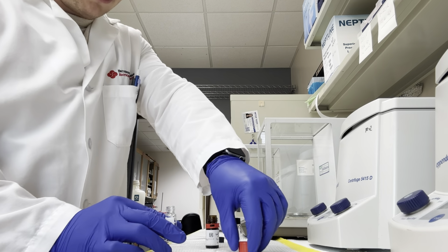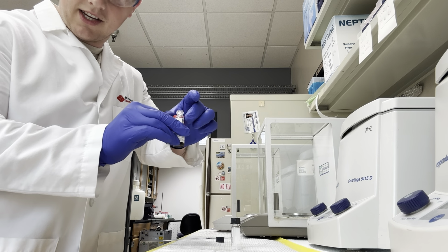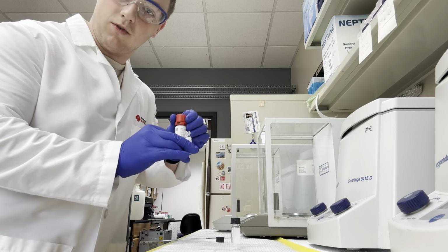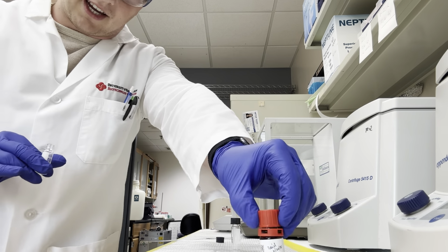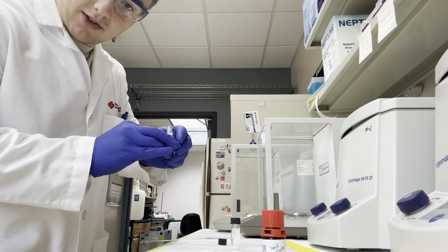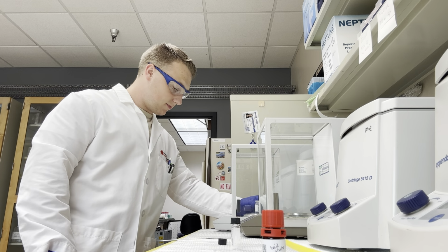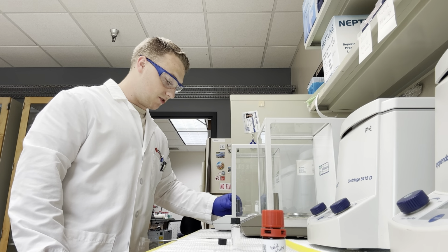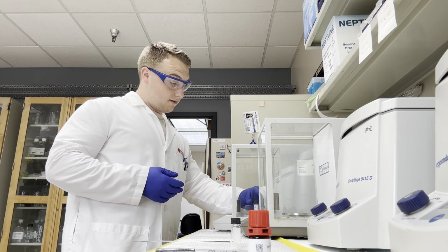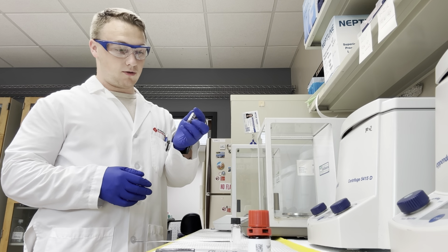The first thing we want to do is make sure that our stock is all sealed up. Obviously if our stock is contaminated, then it ruins everything, and we have to buy another one. So let's make sure that's clean and taken care of. Now again, no cap, because we didn't zero the scale with the cap on. We're going to put this back on, and our scale is going to give us a measurement. Once we've weighed it, we were fortunate enough to get right on the dot with 10 milligrams.